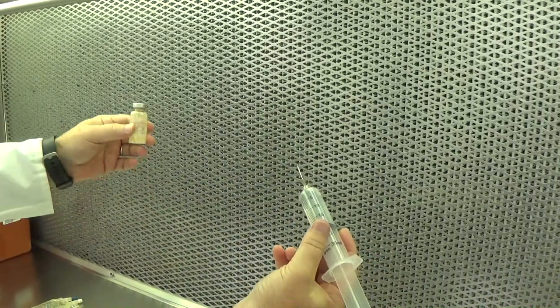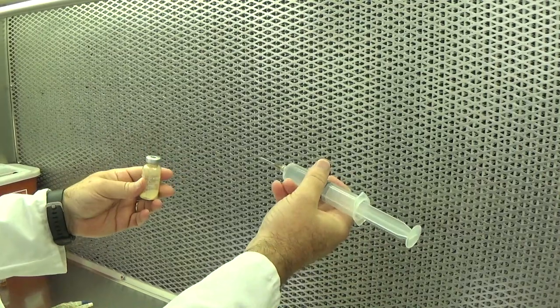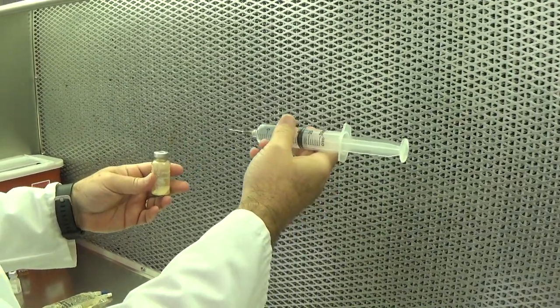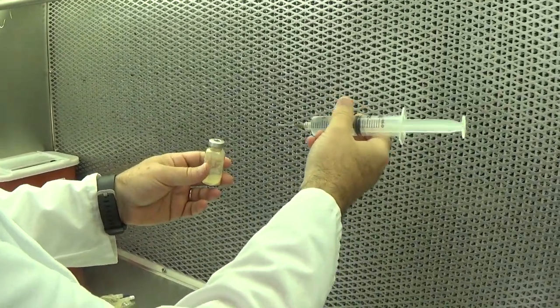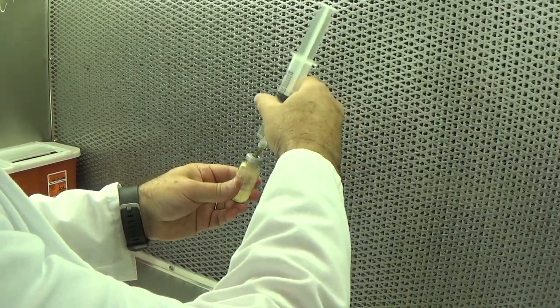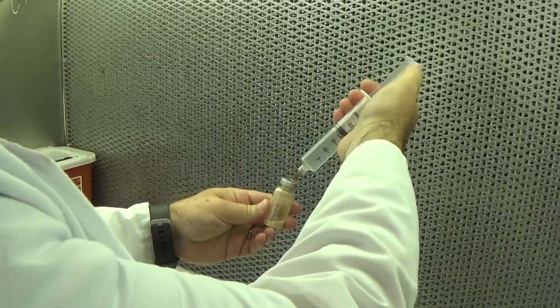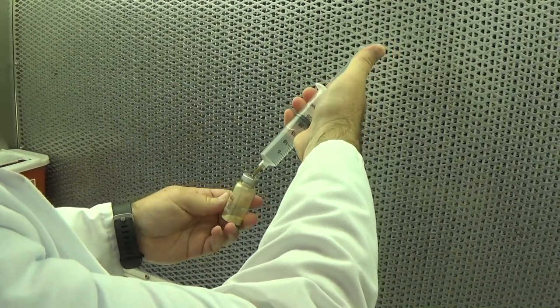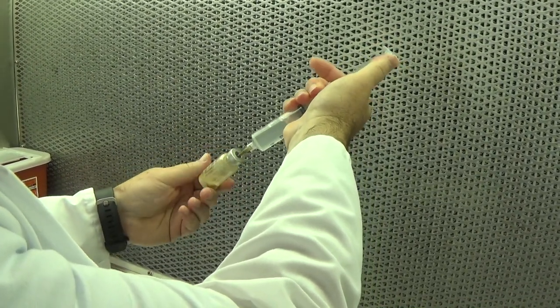This powder requires 20 milliliters sterile water. As I introduce the needle, I'm going to try to direct the flow of water to the side of the vial. And again, I pull back and let the vacuum pull it.